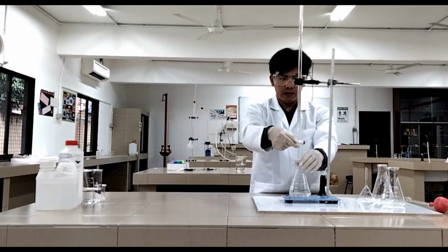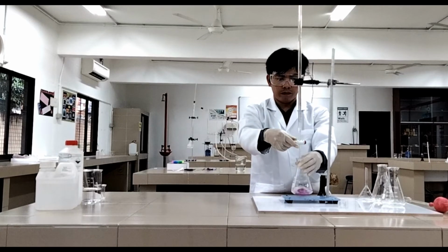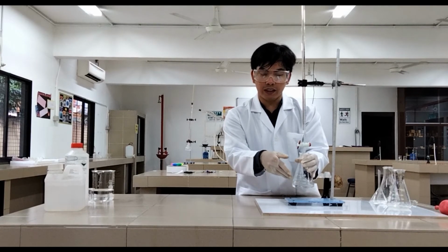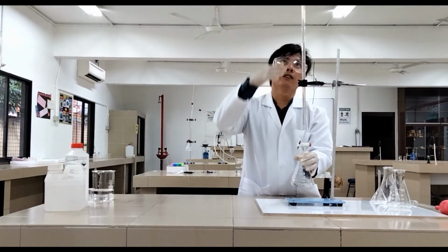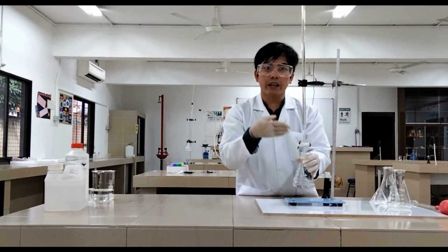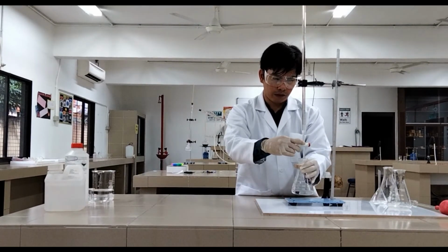Okay, so let's put some more. Then make sure you shake it. Since it's hard for us to turn this solution colorless again, it means we are near the neutral substance. We are near its neutralization. So we just add the sodium hydroxide drop by drop. So far we have used 6 ml of sodium hydroxide already. Now we're just going to do it drop by drop. Once it turns pink, we can say that it is the amount needed to neutralize the acid. So again, it is 6 ml. We just add it drop by drop.